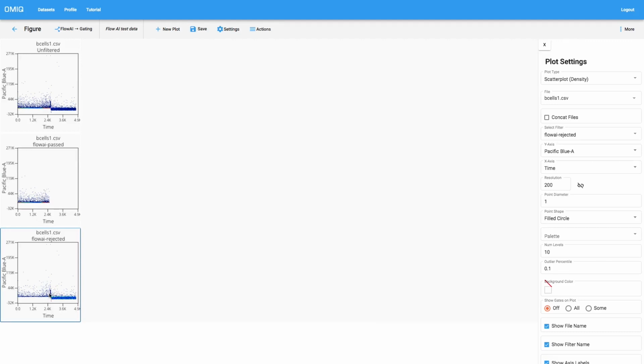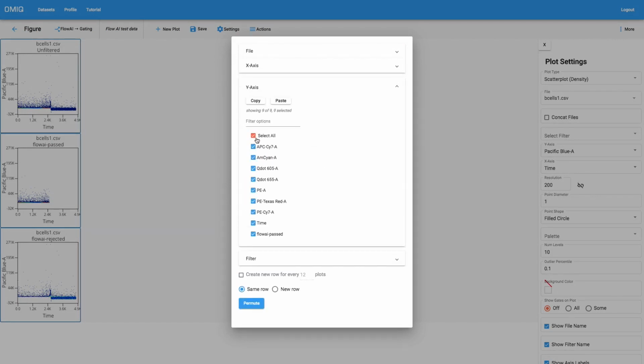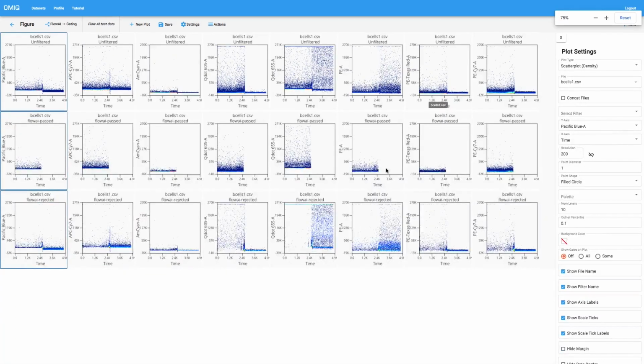And so we can see that actually flowai does reject events from within what would otherwise appear as a pretty clean part of the distribution, but it definitely heavily rejects events to the right after this disruption, this clear disruption that we have in the acquisition. And so we can also perhaps understand better why these events get rejected by looking at our different parameters of interest. And so we'll now choose those, not as the x-axis. We'll choose them as the y-axis, and we'll get rid of those two parameters. And so now we're looking at this figure, and I'll zoom it out a little bit.